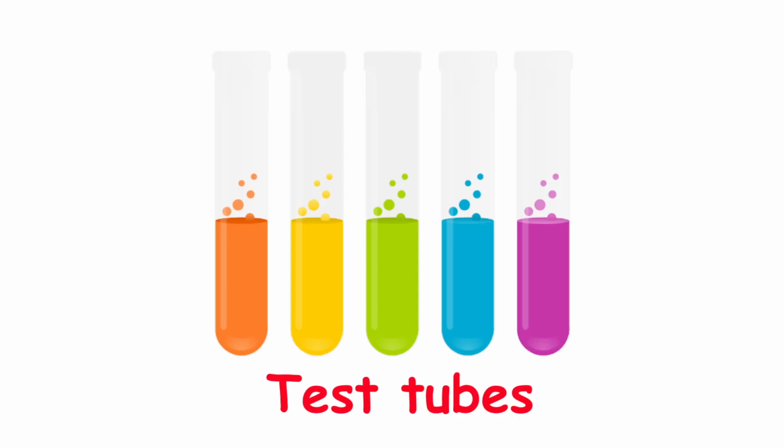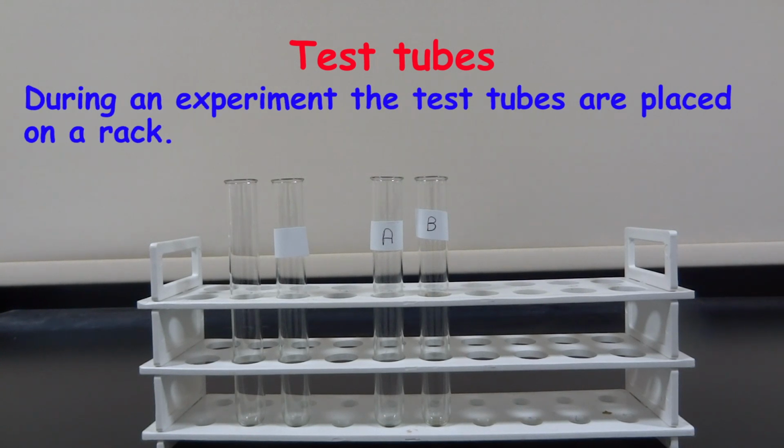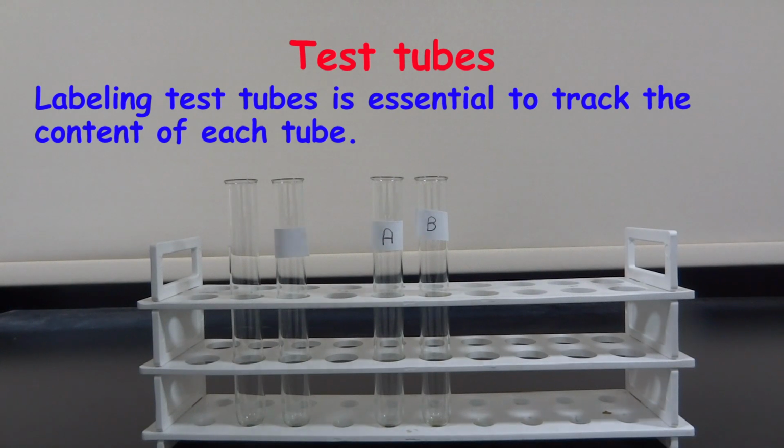Test tubes. Test tubes are used to hold chemicals while experimenting. They are useful during qualitative tests. During an experiment, the test tubes are placed on a rack. Labeling test tubes is essential to track the content of each tube.